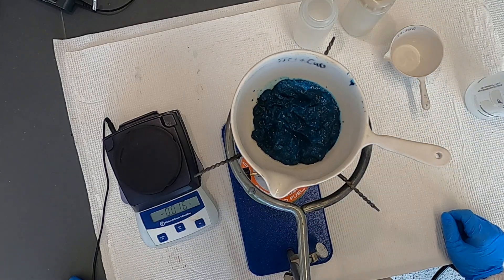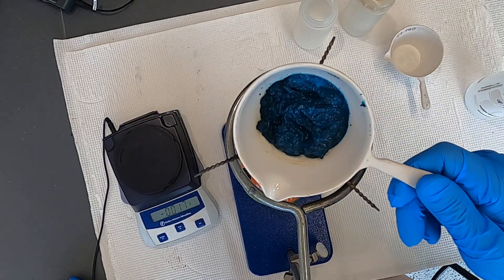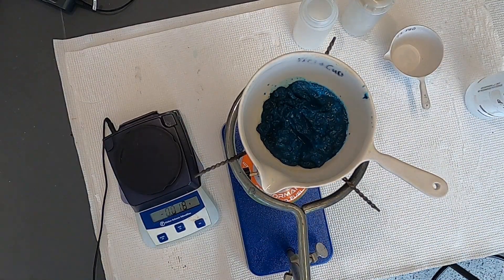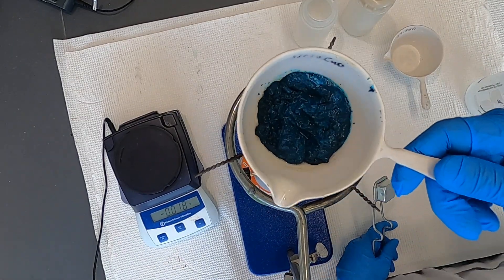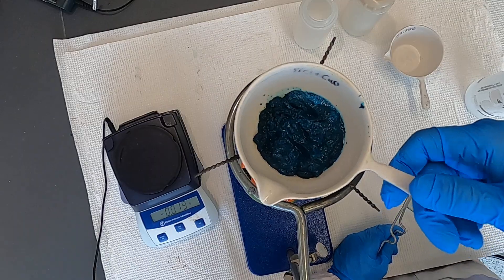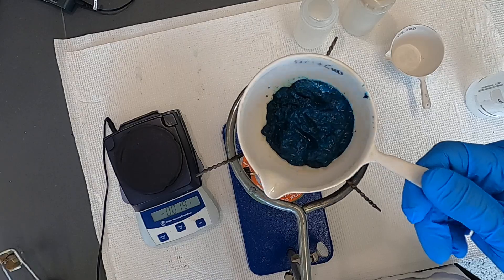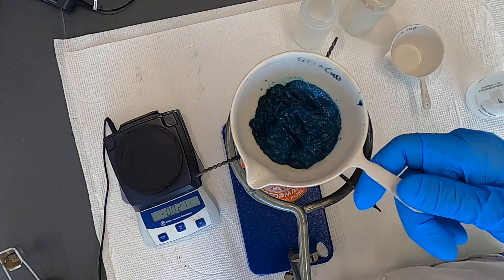The final step is to heat this over a flame and it should react. As you can see it's bluish now — a little bit of a dark blue — and I'm going to heat it over a flame to finally yield our copper oxide. This crucible has a nice little handle. I've already recorded the mass, and in the simulation the goal was to do this in a test tube, but in practice the test tube isn't very practical, so I found it better to use this crucible.